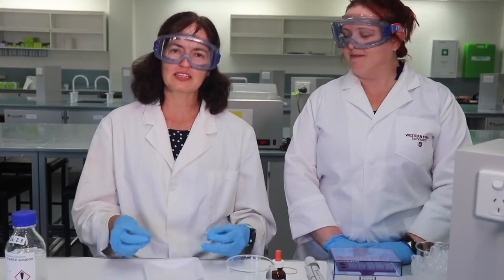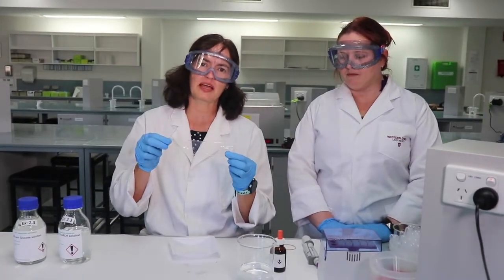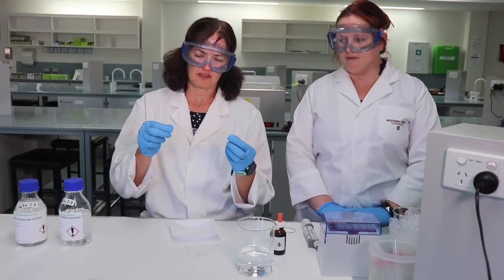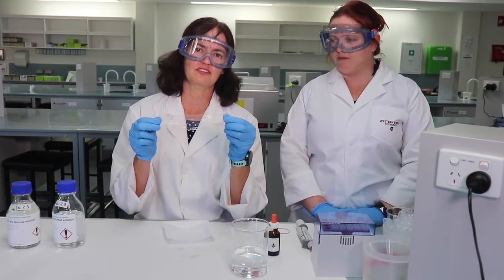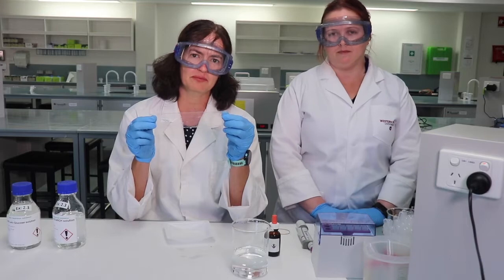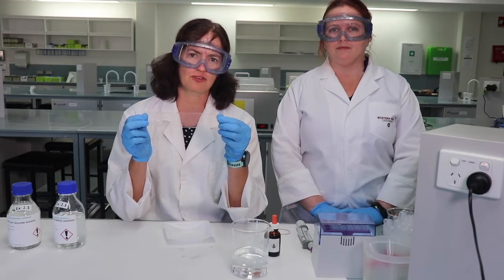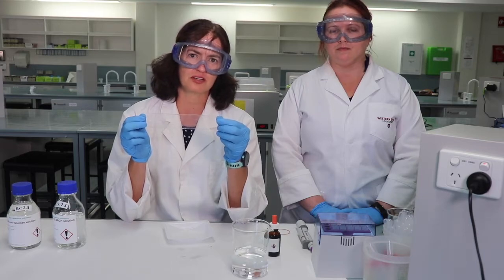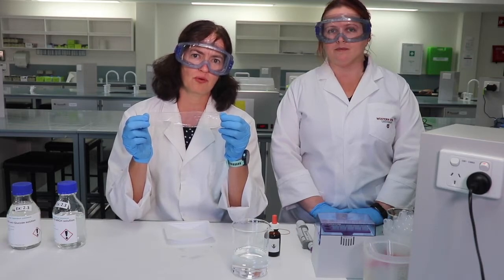The first thing we need to do is set up an experiment in a beaker with this dialysis tubing, which is made of cellulose and has a pore size of a fixed size. So it's very different from a living cell's membrane, because living cells, remember, are selectively permeable and will actively choose and control what can enter and leave the cell. In the case of dialysis tubing, what can move through the pores are substances smaller than the pore size.